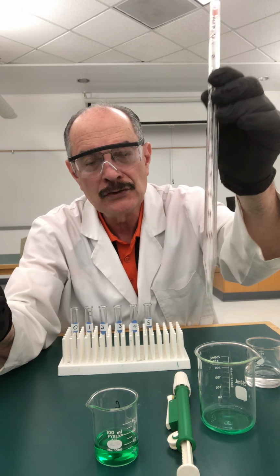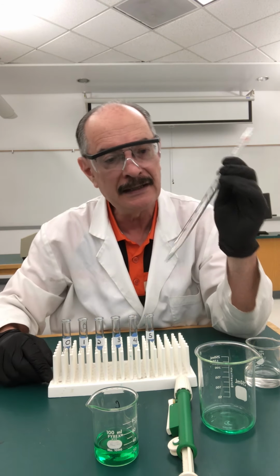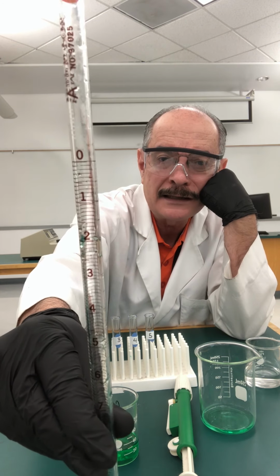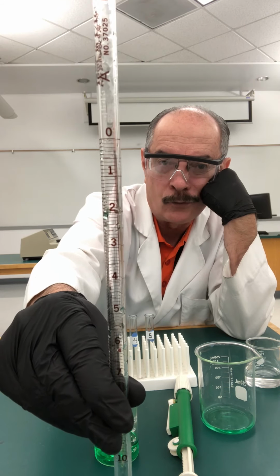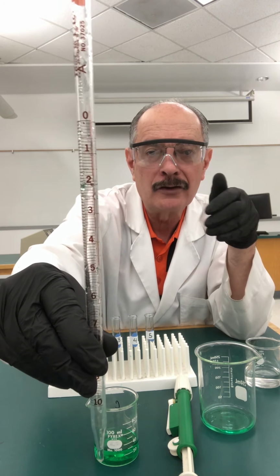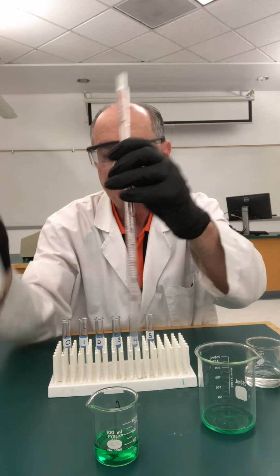Okay, so let's get ready to do our dilutions. Remember, the idea is to put 0, 1, 2, 3, 4, 5 milliliters in each. So we'll probably have to do a few rounds of this. Remember, the pipette is calibrated in milliliters, but notice that unlike the graduated cylinder, it's kind of inverted. It starts with 0 and it goes downwards. Again, like a burette, because you're interested in measuring the volume of liquid you've delivered, not the volume of liquid that's left in there, all right? So once more, what I'm going to do is set up my adapter here.